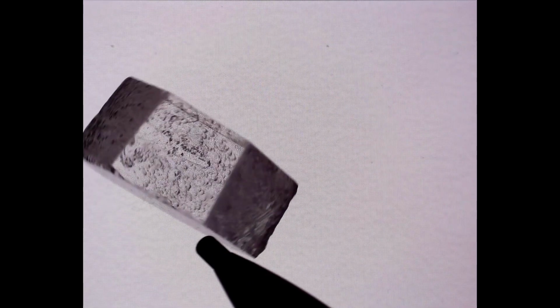Let's rotate our quartz crystal now and see if we notice any pleochroism. And as we start to spin the quartz crystal, you can see, well, nothing's really happening here. Because our rock crystal is clear to begin with, there's no coloring agent to cause differential absorption of light as we're looking through our crystal. And so we don't actually see any pleochroism with the clear quartz. This will be a little different for our later varieties of quartz, which actually have coloring agents and so can differentially absorb light. So let's return our quartz slice so that we're viewing again down the c-crystallographic axis.